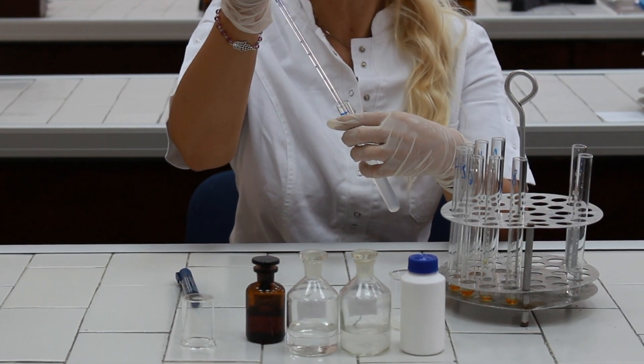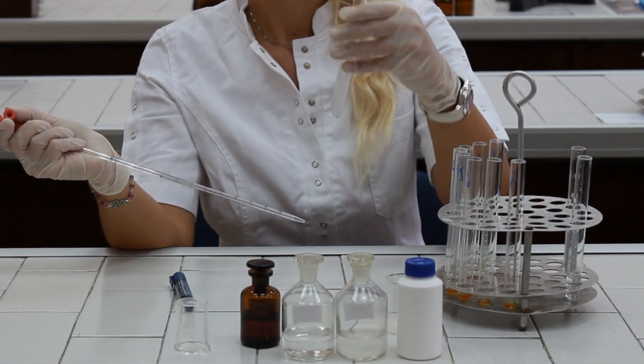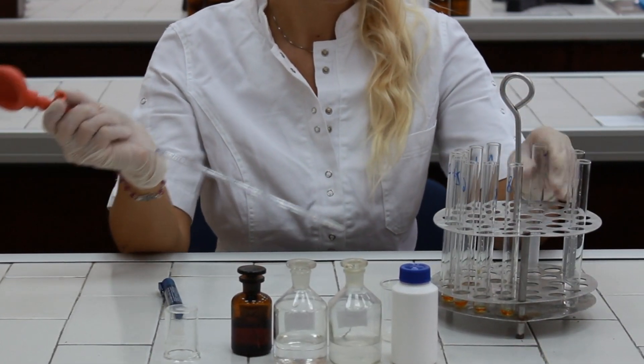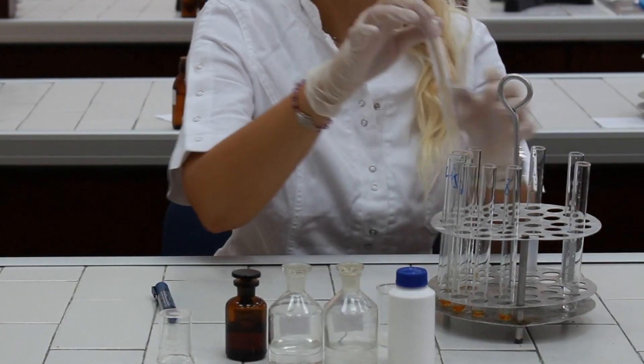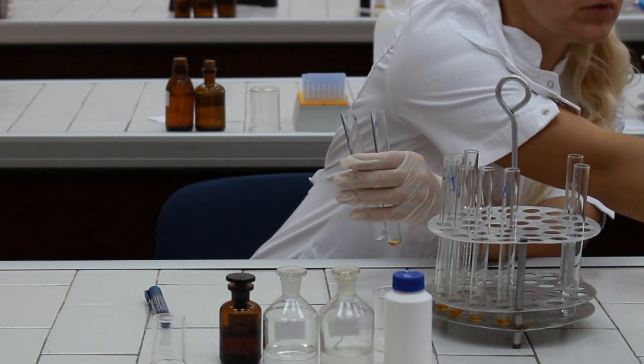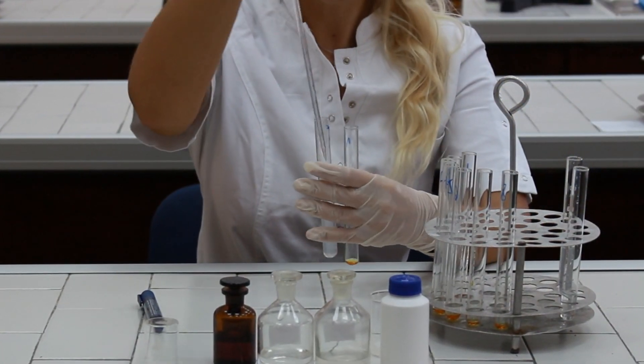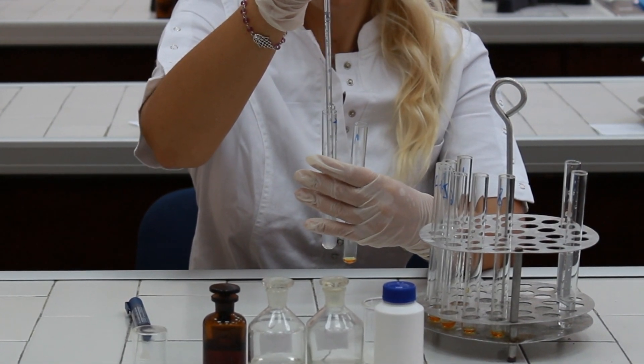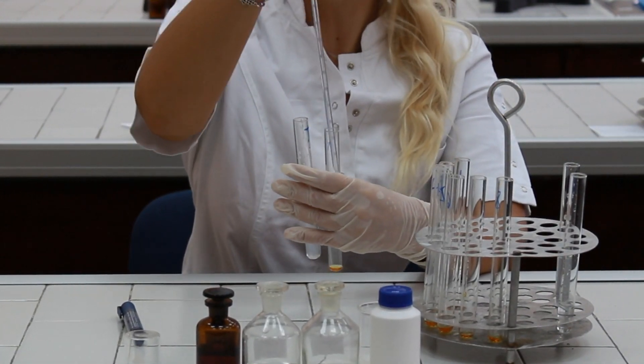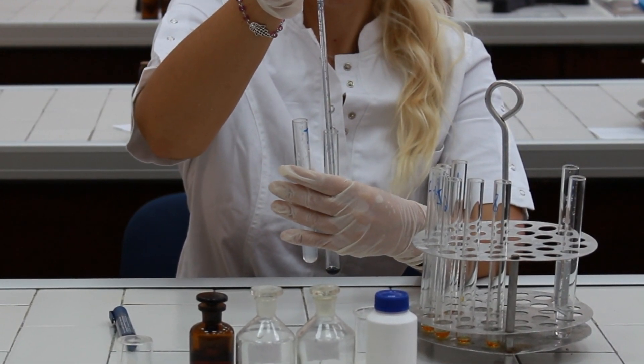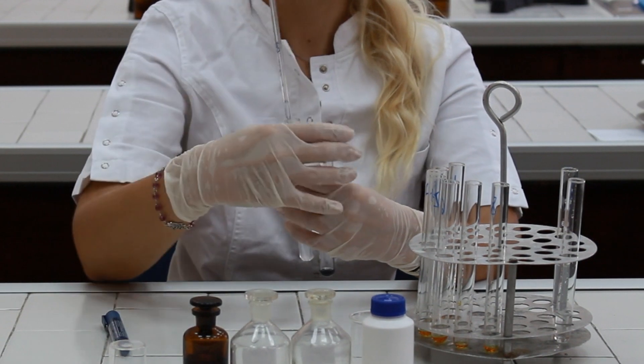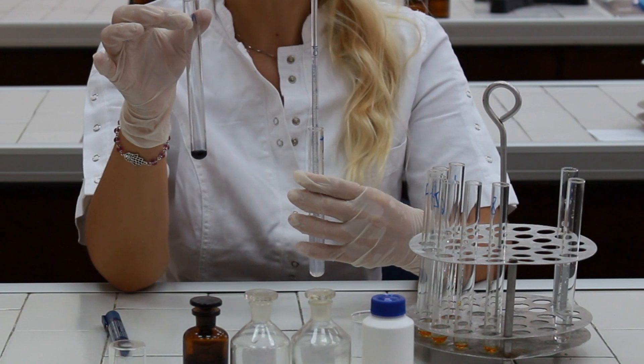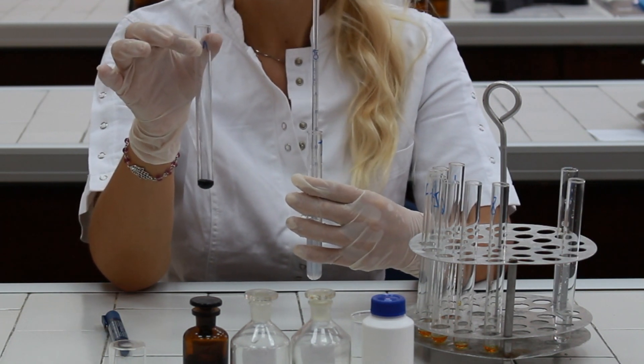The reaction starts by the addition of an enzyme. Mix the test tube and then transfer a certain small quantity, around half a milliliter, from the T test tube to the test tube number one. Notice the formation of indigo blue color which is the result of physical interaction of starch with iodine.